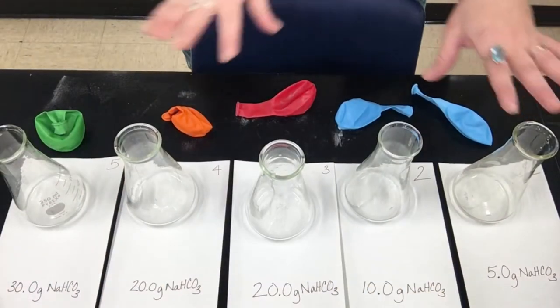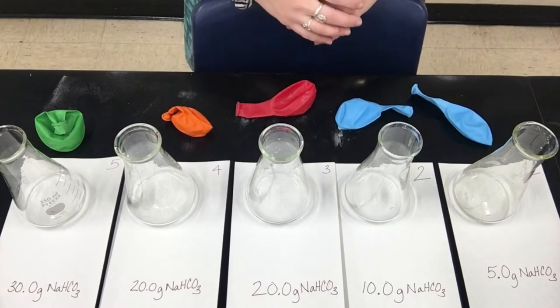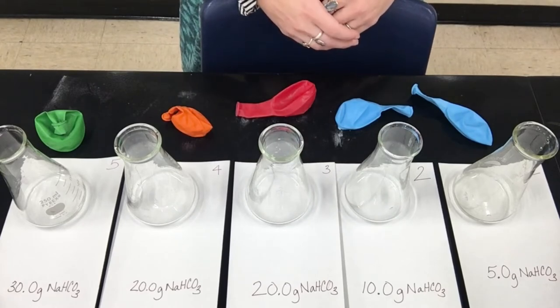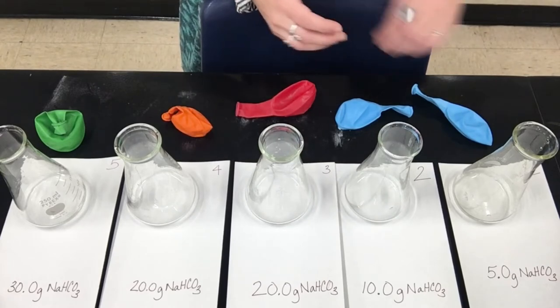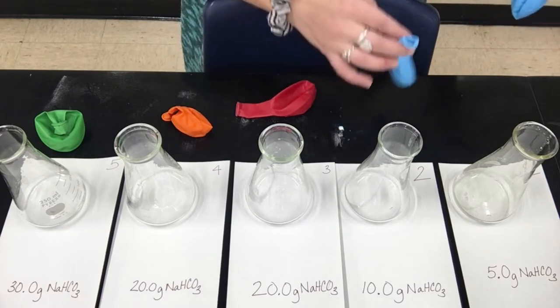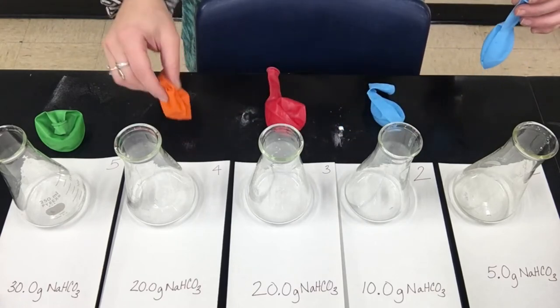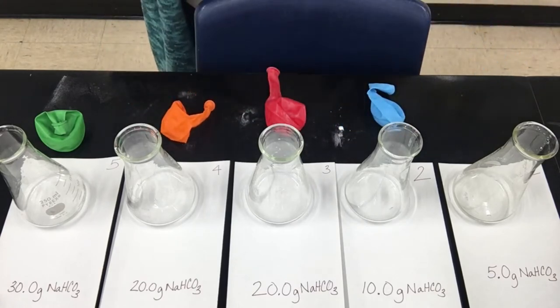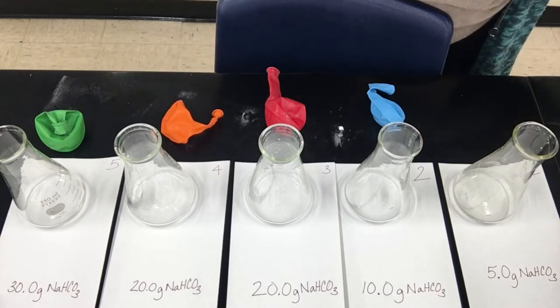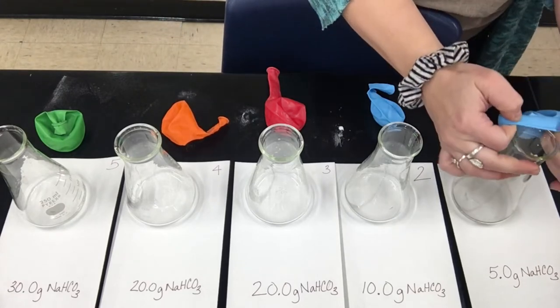Here we have a series of Erlenmeyer flasks, each containing 20 milliliters of acetic acid or vinegar. In each of these balloons, I have a different amount of baking soda. So what we're going to do is put the balloons on top of these Erlenmeyer flasks and watch our reaction occur.